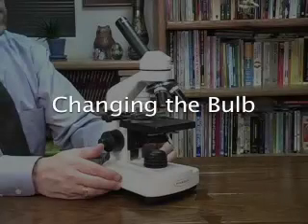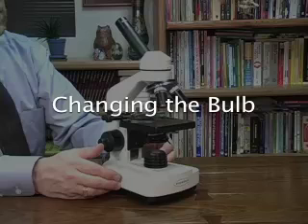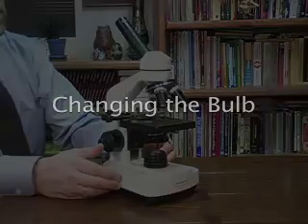Hi, John Holzmann here. I'd like to show you how to change the light bulb in the MS-01 Ultra Microscope. Some people get pretty frustrated with it. It's not immediately obvious, but I think it's actually pretty easy.